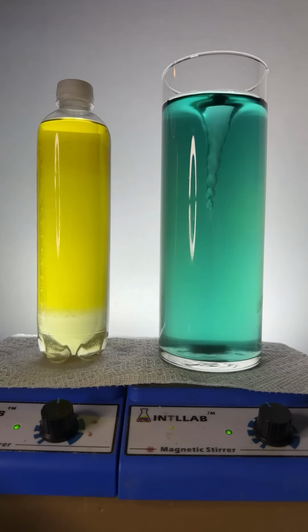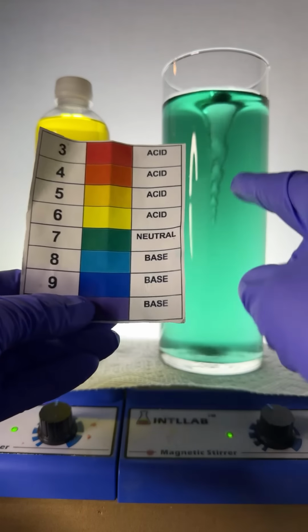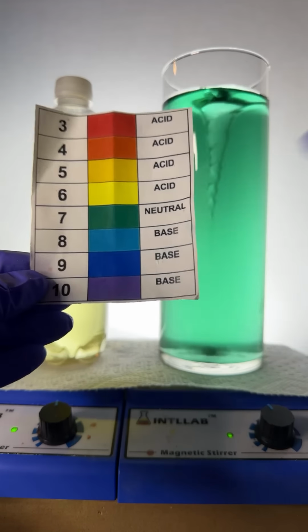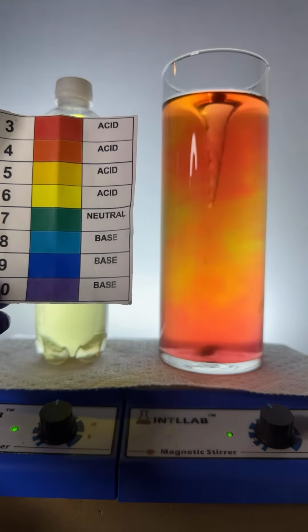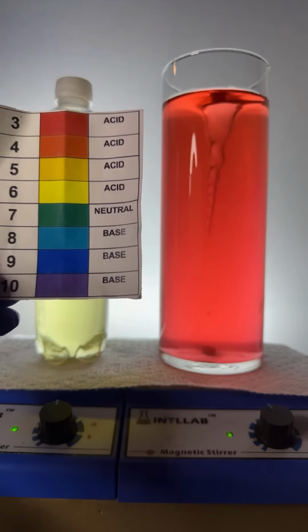And these are the different colors you will see at the different pH values. Like now, it's a green color. It's a little bit bluish green, so it's a little above pH 7. It's just a little bit basic. If I start adding acid to it, hydrochloric acid, the same acid that's found in your stomach, you start to see that pH drop. Come on now, we're down to about pH, I'm going to say 4, maybe 3.